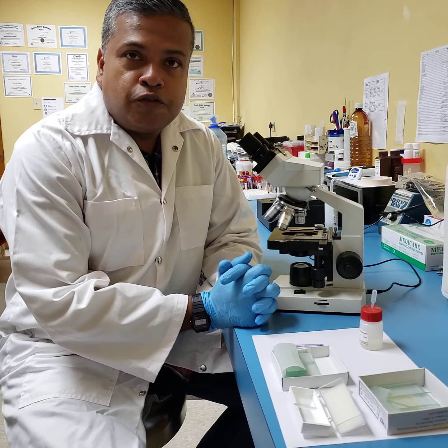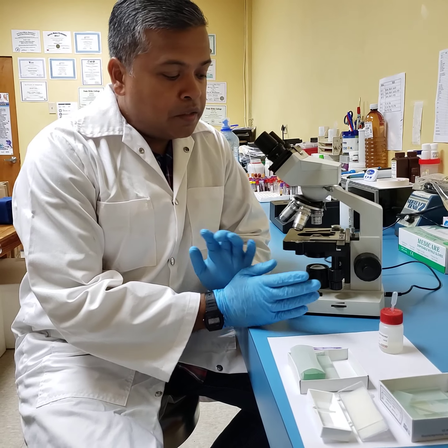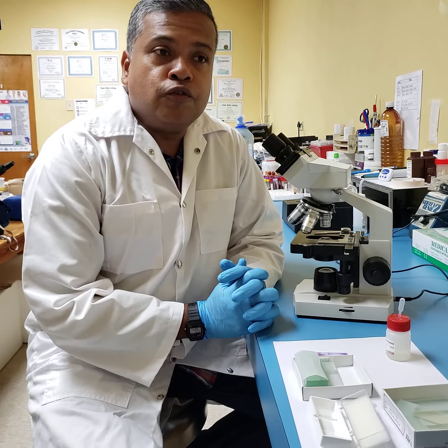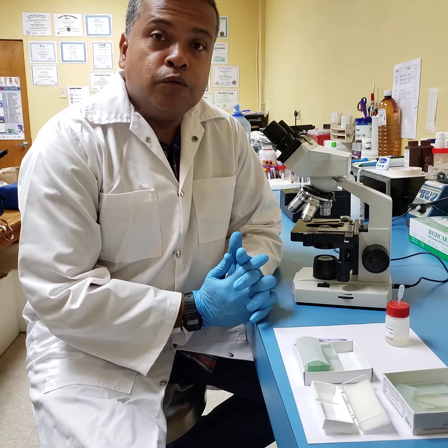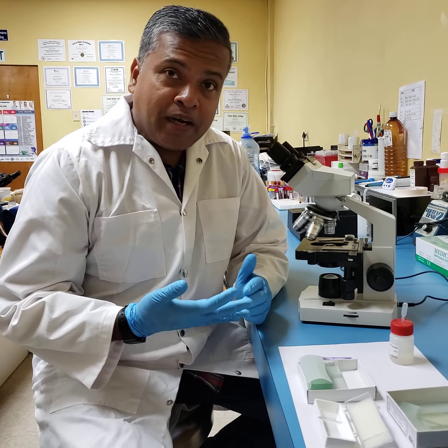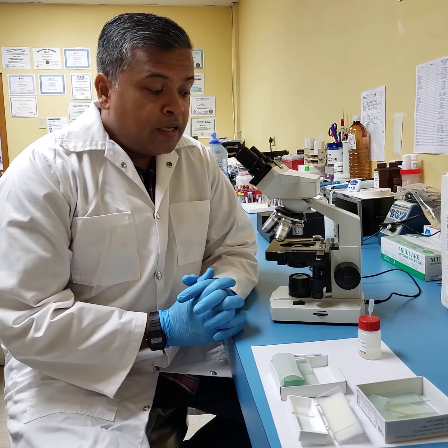Today I want to introduce you, in one of our video sessions, to a very important tool we all use in the laboratory. Nothing other than the microscope. As a phlebotomist, or if you are an MLA, and even if you are aspiring to do medical technology, one of the most important tools you will use in the laboratory is a microscope. It has applications in different departments: in hematology, in microbiology, even in immunology. The microscope is an often used piece of equipment.